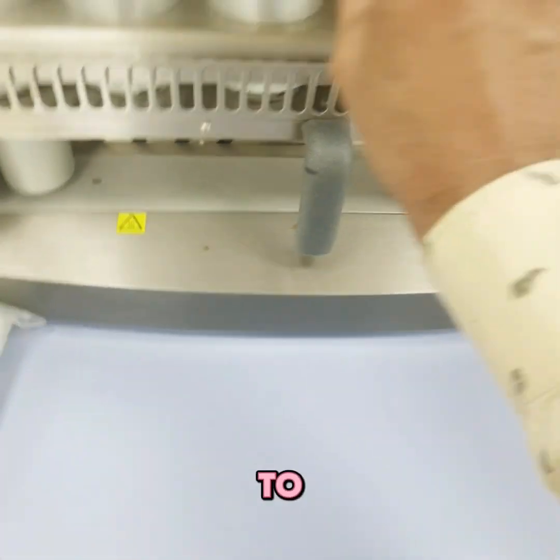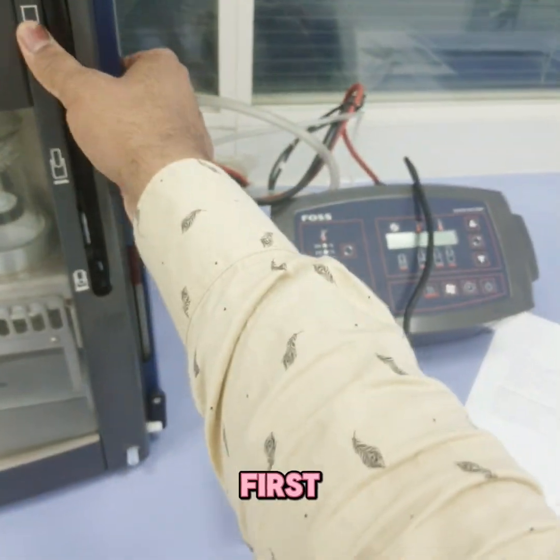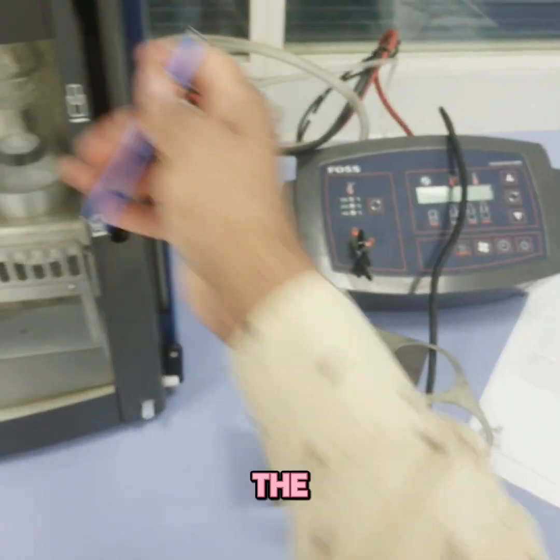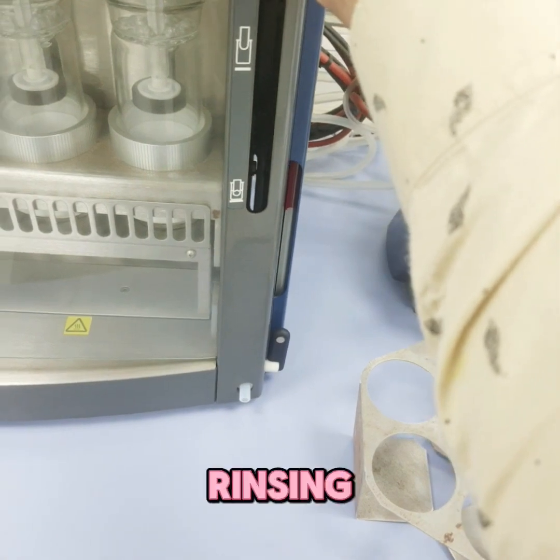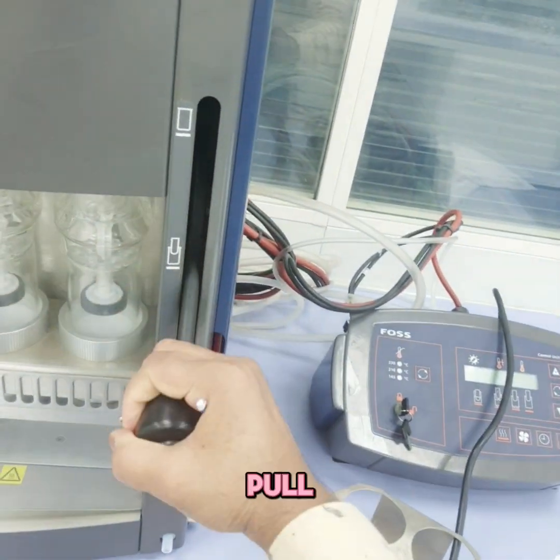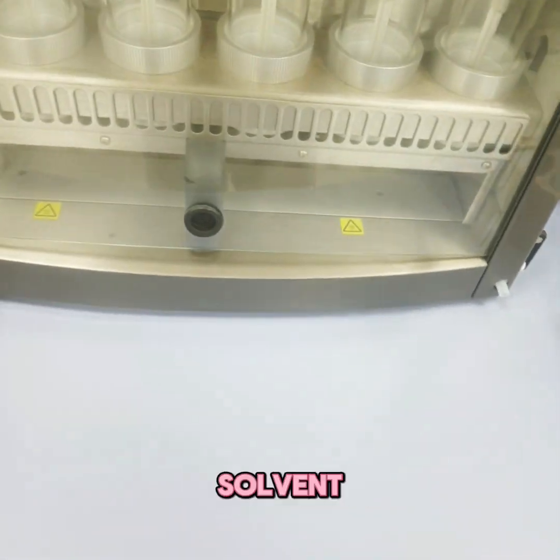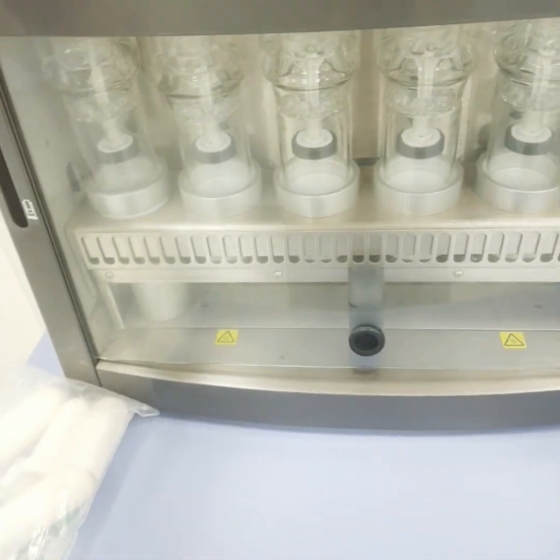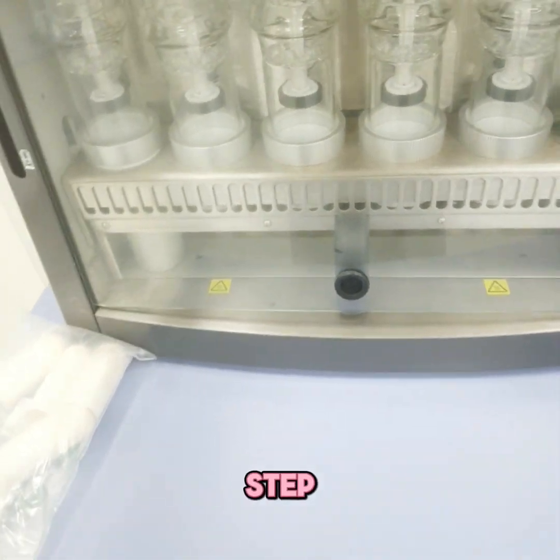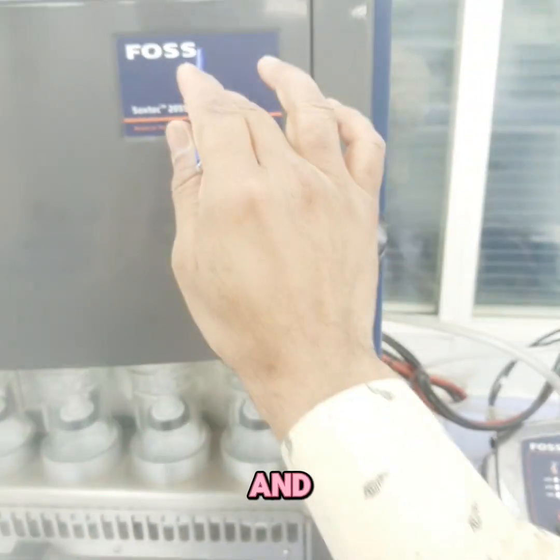In this video we're showing a demonstration of the three steps. First, the thimble with sample is placed here, then covered. The levers are used to pull the samples down so the thimbles make contact with the solvent, extracting all oils and fats. These were all the features of the Soxtec 2045, manufactured by FOSS.